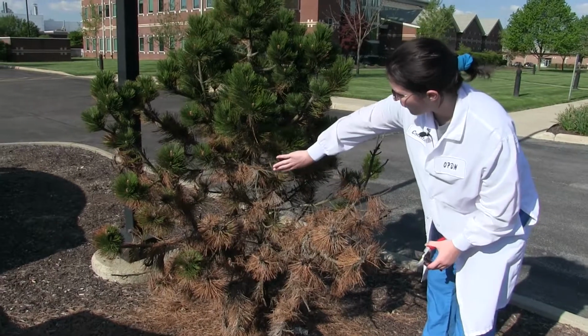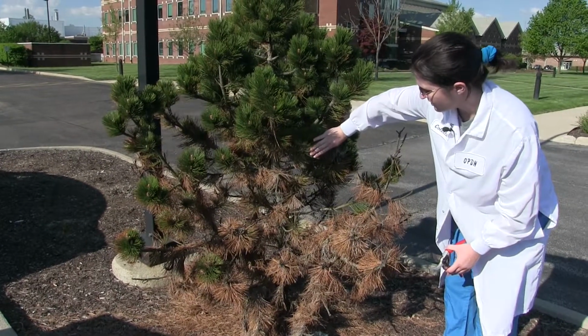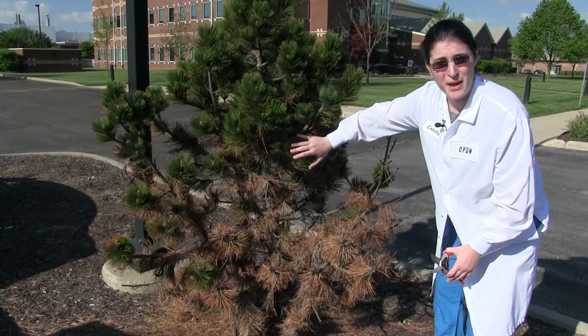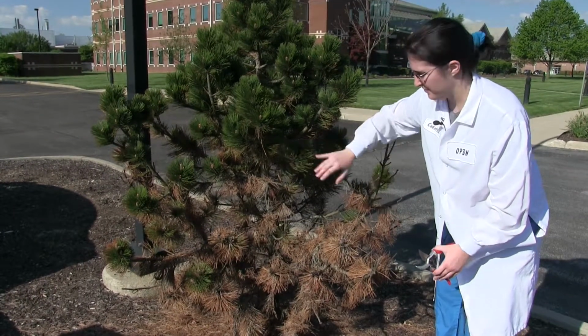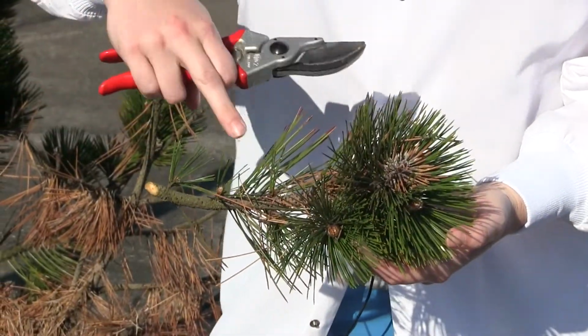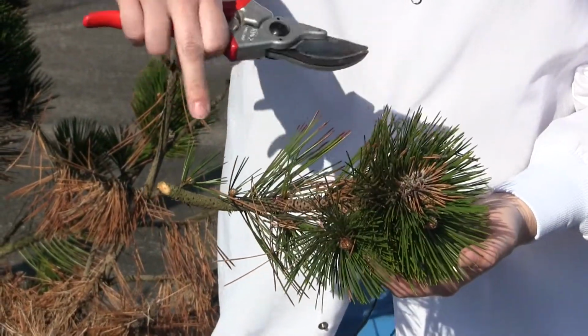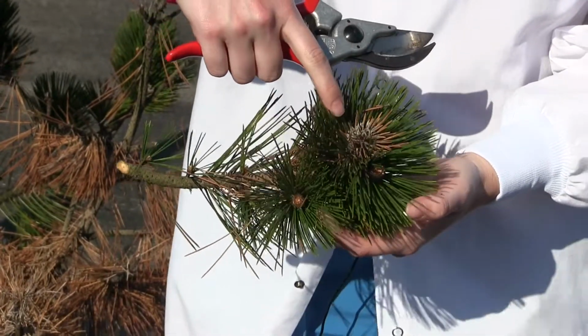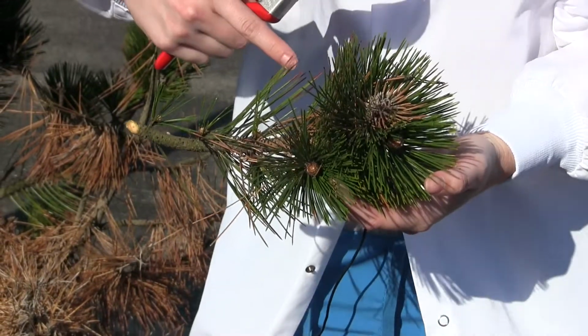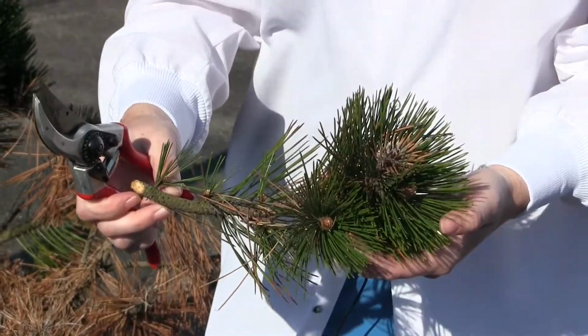We're going to want to go farther here where there's dead needles and live needles, because this is where the pathogen or insect is going to be located. So you take your sample. As you can see, there are dying needles, dead needles, and also here, there's dead spots, but there's still quite a large amount of green. This is a good sample.